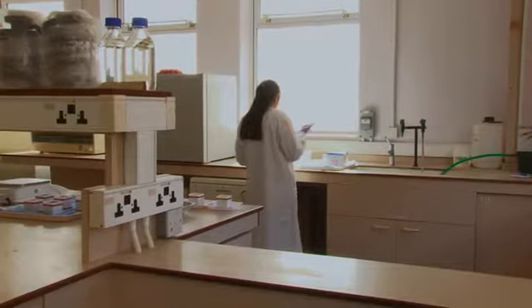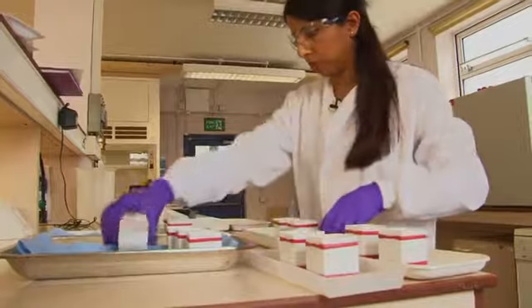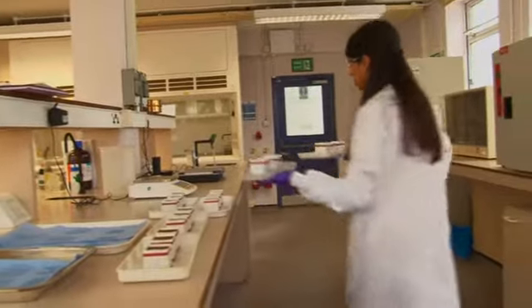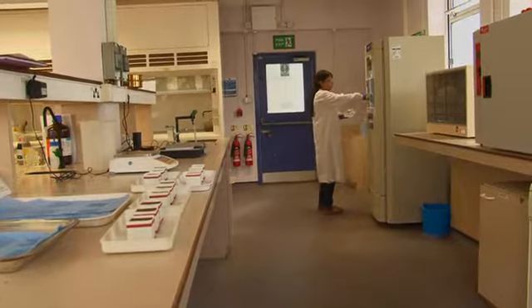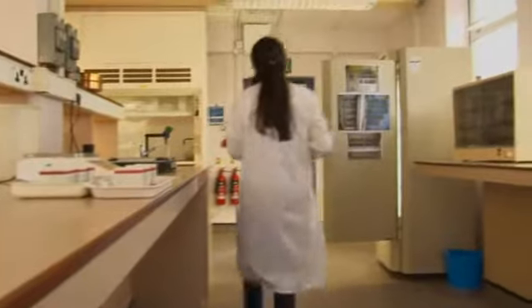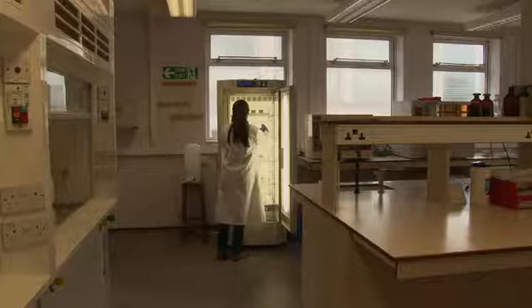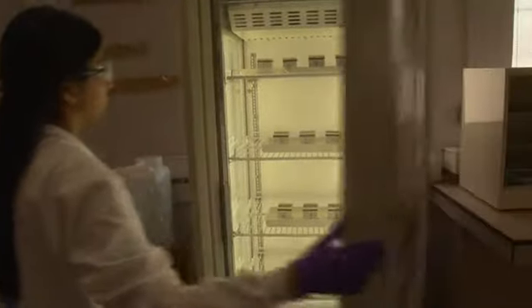Once we've inoculated the blocks with the algal solution, it's time to put them in trays. So importantly, it's necessary to separate the controls from the inoculated blocks and then put them in the growth cabinet under the right environmental conditions. Over the course of the month of growth, we'll be measuring how the stone changes, so weekly measurements and half-weekly measurements. And correlating these, we can get an idea of how the stone responds to the growth. So whether the stone is deteriorated by the growth or, in fact, if the algae is protecting the surface.